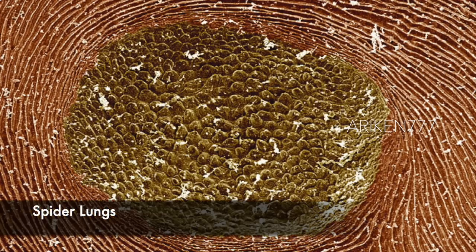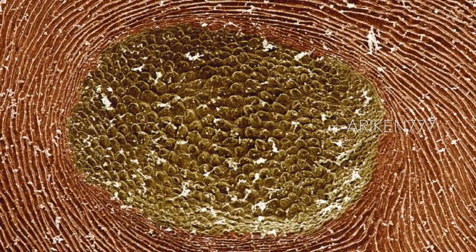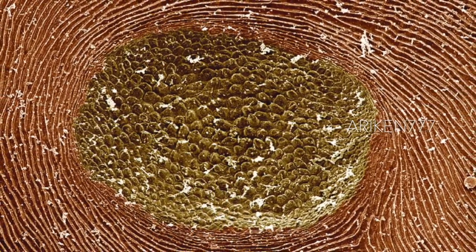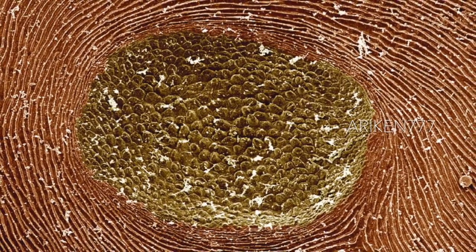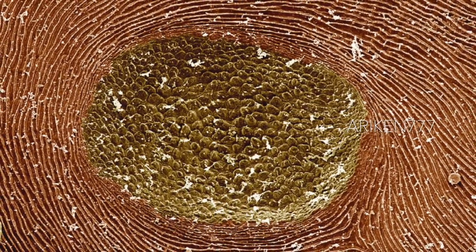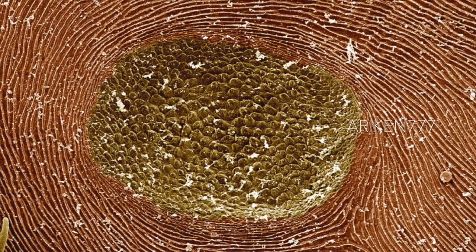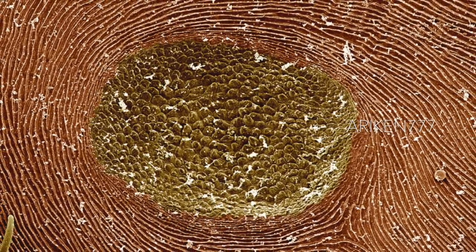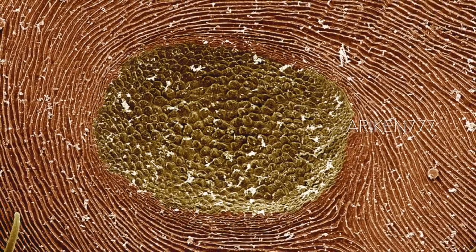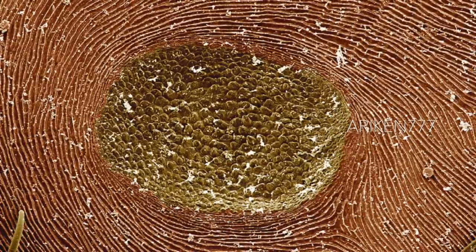Book lungs of an orb-weaver spider. A book lung is a form of respiratory organ found in certain air-breathing arachnid arthropods like scorpions and some spiders. Each book lung consists of a series of thin plates that are highly vascular and are arranged in relation to each other like the pages of a book. These plates extend into an internal pouch formed by the external skeleton that opens to the exterior by a small slit, providing an extensive surface for the exchange of oxygen and carbon dioxide with the surrounding air. There are four pairs in scorpions and up to two in spiders.